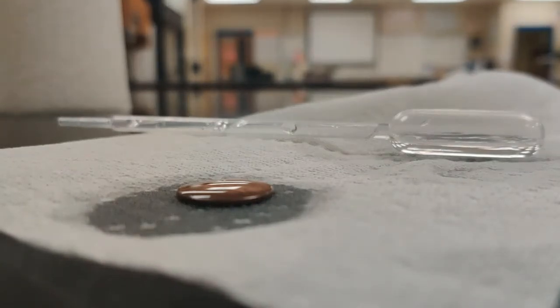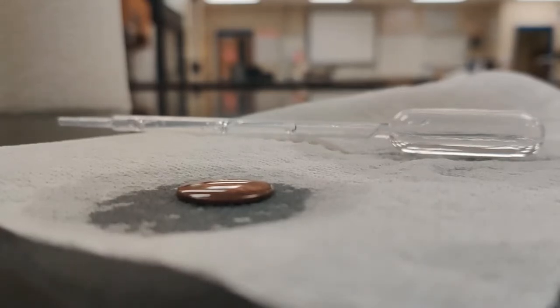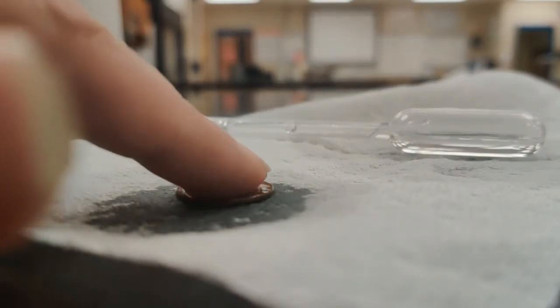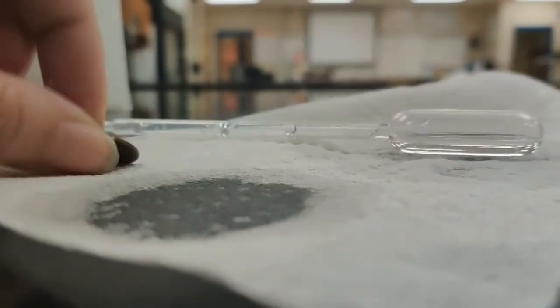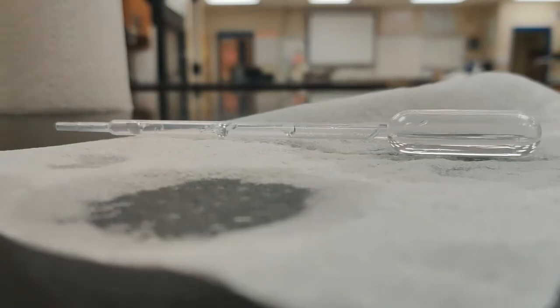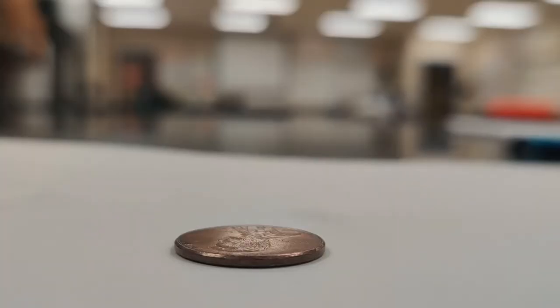What I do find kind of interesting is that when one drop really rolls off the top, instead of keeping it all together, the whole thing kind of flows. So you can see there's not a lot of liquid left on here. It has all rolled off at once, and it all went in one direction. You can see it's much more damp over here on this side than on the other side of the penny. All right, so now we are going to use our soapy water.